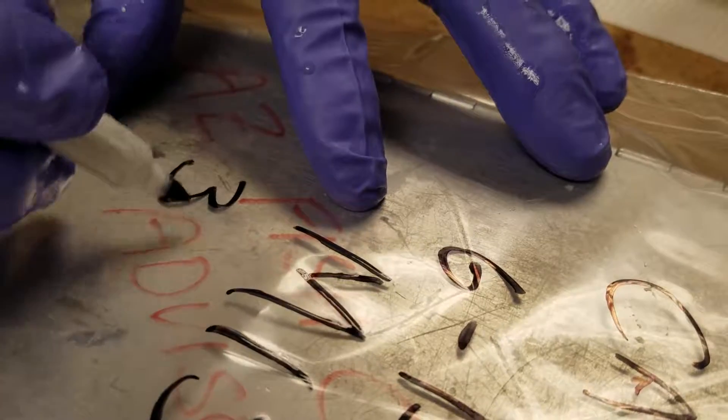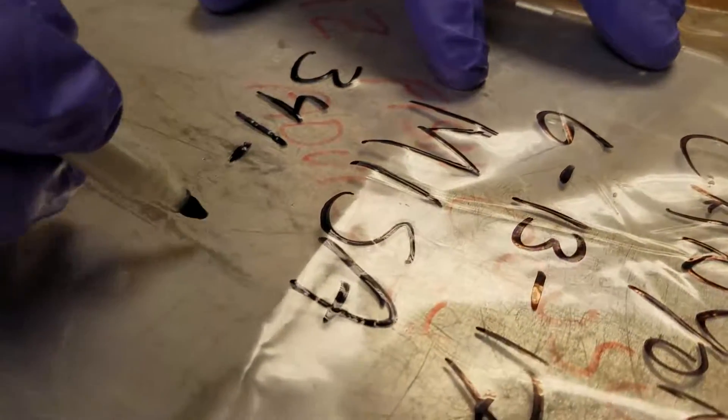513. The reason why we get length and weight is that the fish, if they're in poorer condition — if they're skinnier fish — a lot of times the mercury will be higher in the fish. The length and weight is 341 and 5.